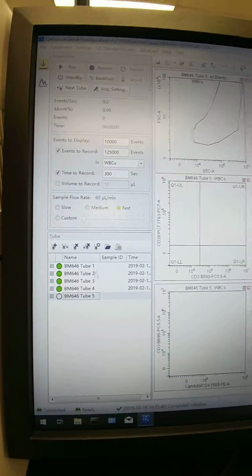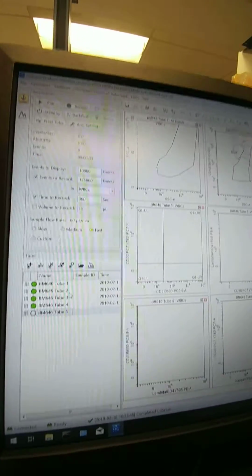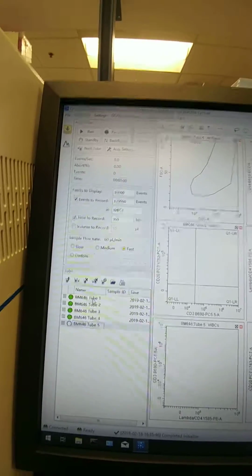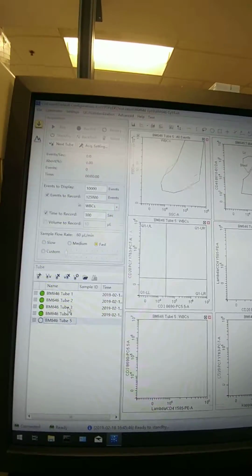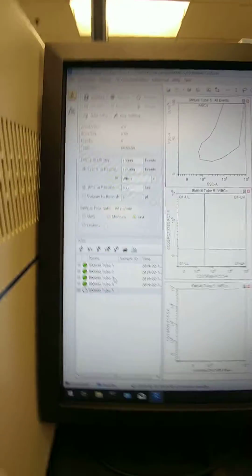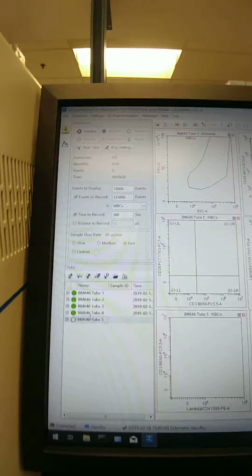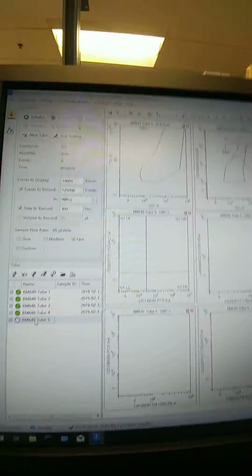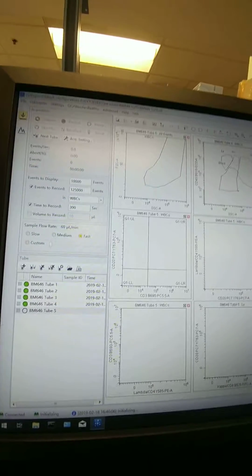So in this case, tube 1, tube 2, tube 3, tube 4, that doesn't mean the first tube you run, the second tube you run, the third tube you run. It's specific to tube 1 being the kappa lambda tube. Tube 2 is the 510 tube, tube 3 the 3338, tube 4 the 15117. So it's okay if you run them in any order, but if you pick up the tube 4 tube first and want to run it, make sure you select tube 4. Okay, so we're going to do tube 5 here, which is really a repeat of tube 1.